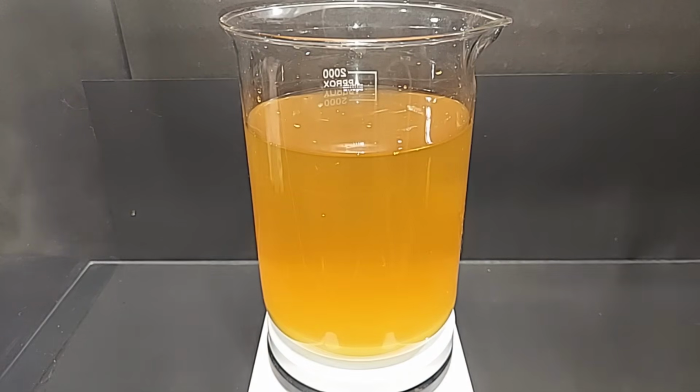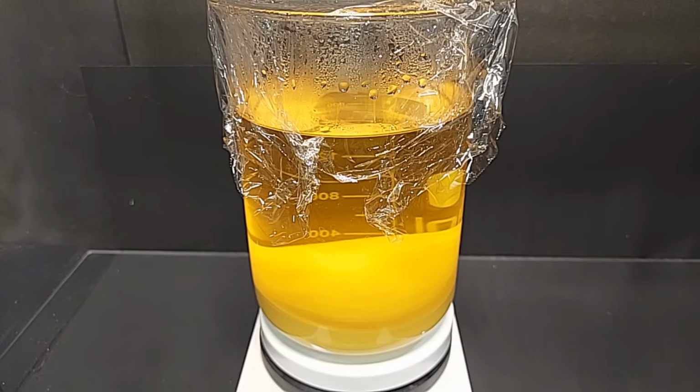It's been a full hour since I turned off the magnetic stir. There are still some small particles in solution, obviously, but it's going to take a while, I think, for those to completely fall out. I'll be back when it's done and ready to vacuum filtrate. This ended up sitting overnight, so I covered it with some plastic wrap. You can see how much clearer the solution is now that all of the iron oxalate has settled. Let's go and filter it.